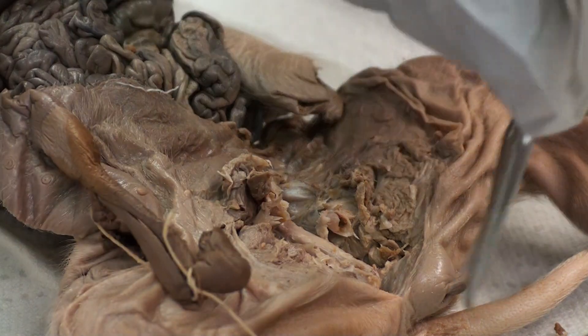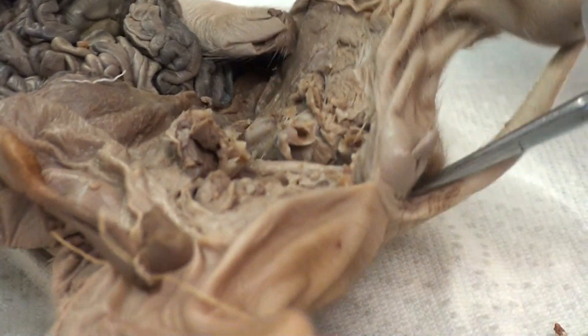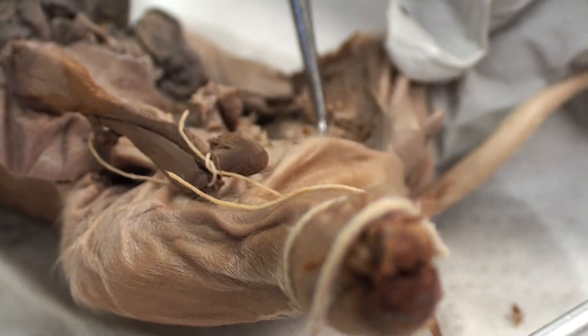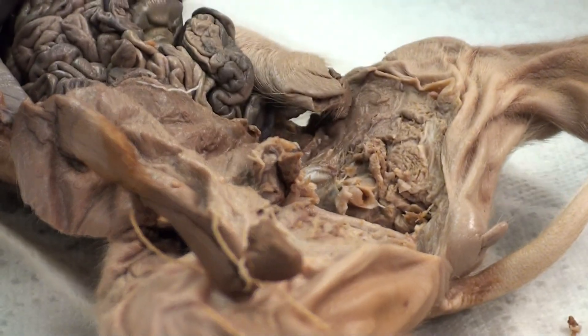And all the way below, if you take a probe and stick it into the anus and go down, you find the rectum. So those are the three tubes. Thank you.